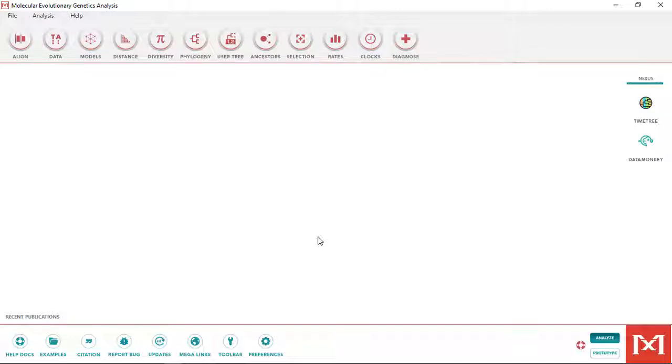This video will walk you through the steps to analyze your SUSHI DNA barcode sequence data. As described in the lab handout, you'll first be assessing the quality of the sequence itself and removing any ambiguous nucleotide assignments made by the algorithm. We'll use a free program called MEGA to do this.